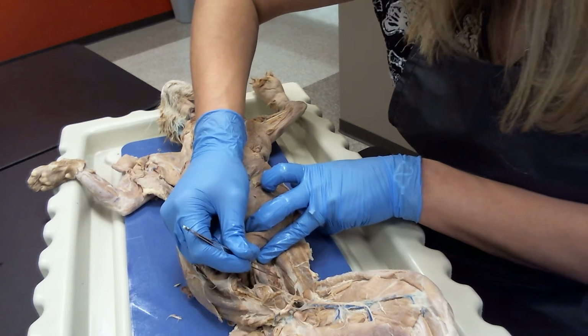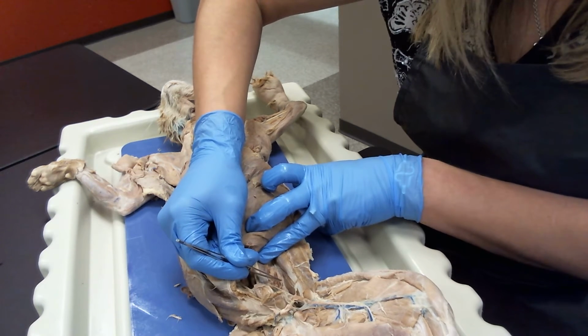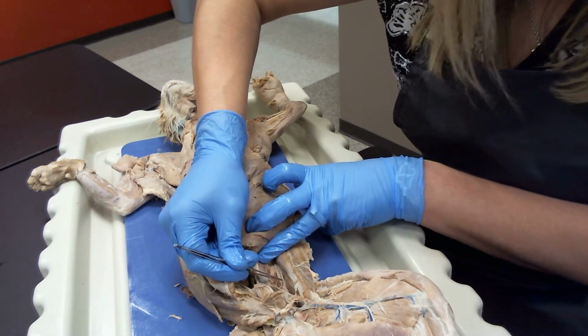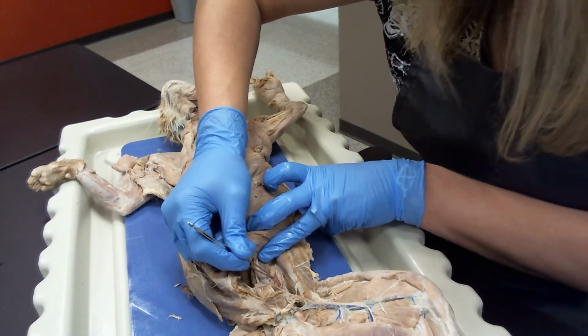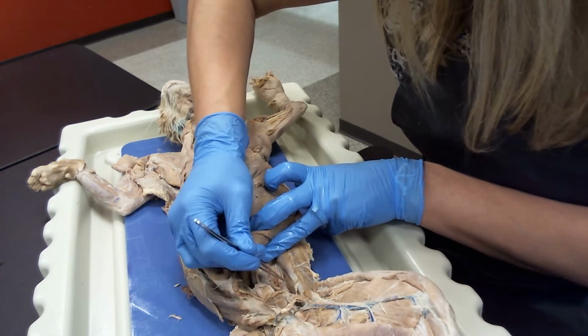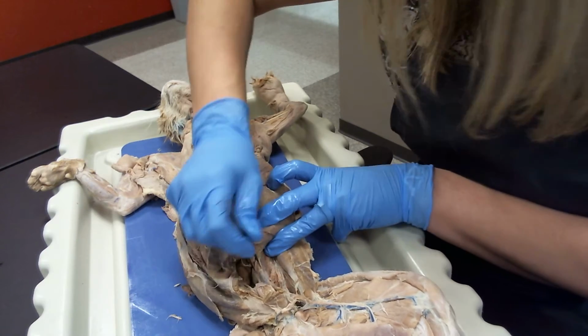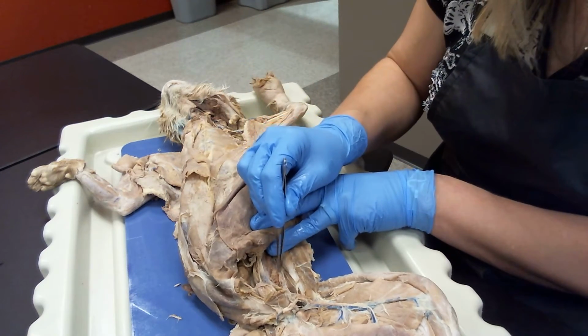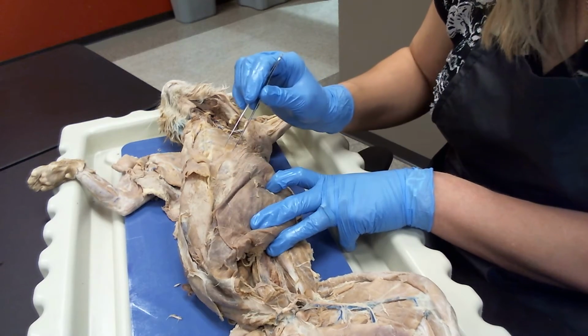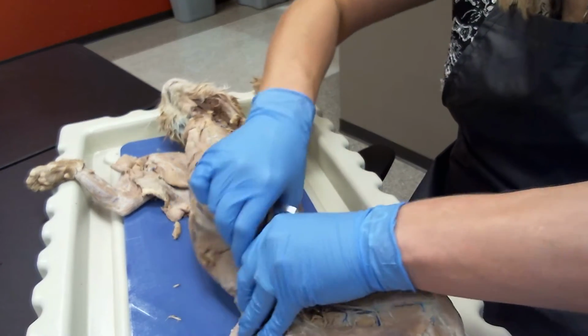You've got one on each side. This is your sympathetic trunk or sympathetic chain. You've got one on this side and one on this side. You can see they've got small little enlargements on them. Those are your sympathetic ganglia. And they're super easy to recognize just because they're literally right under the aorta and the caudal vena cava if you push those over. All right.